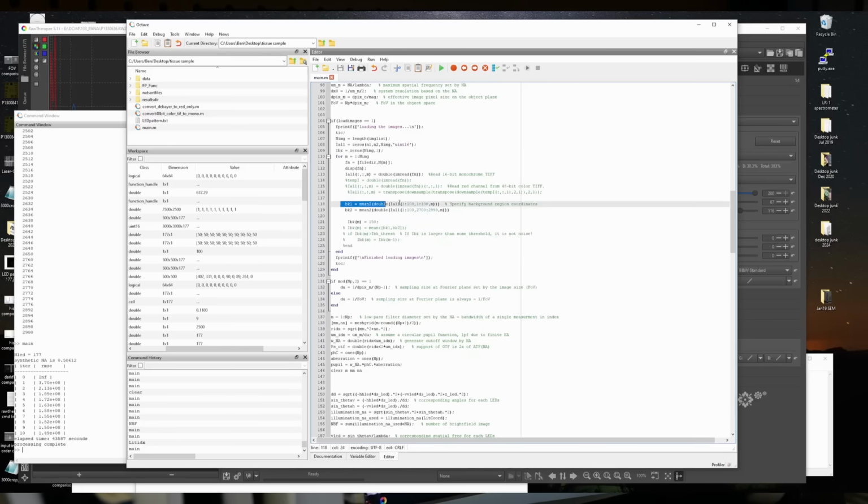It sort of finds a couple regions that are representative of background and attempts to figure out what the background is just based on that. I found it was a lot easier just to figure it out once and just set it to a static value. Although that reminds me of another problem.